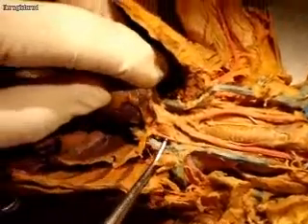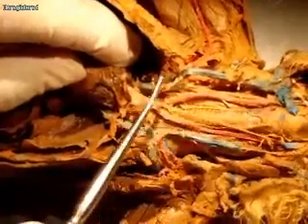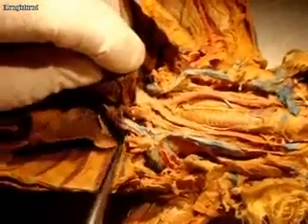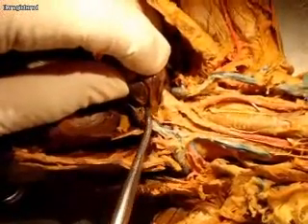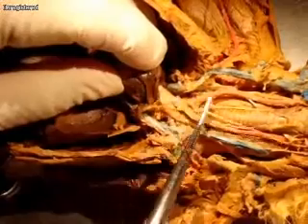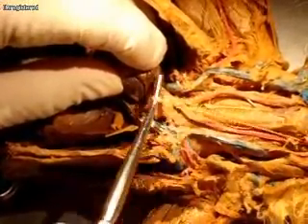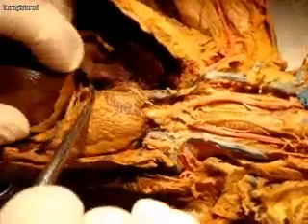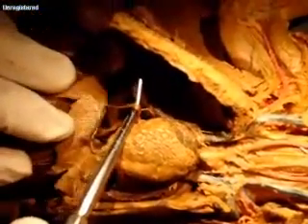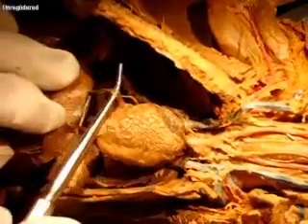Everybody okay with the heart? Now you've also got a couple of nerves. Here's a nerve coming down, and if you look, this nerve is on the left side and it terminates — it looks like it sort of terminates here at the atrium of the heart. So this is going to be the vagus nerve. And then you should have a couple of nerve fibers down here — this would be the phrenic nerve, and that actually inserts into the diaphragm.